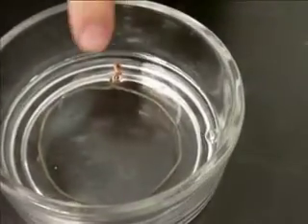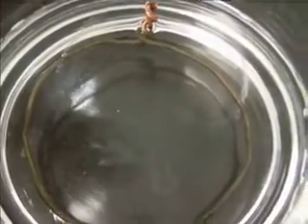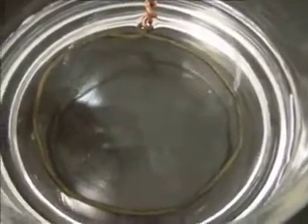Yeah, but you can start to see it's no longer that shiny copper color. It's starting to turn into kind of a darkish color. That's actually silver that's forming on the outside. What we're going to do is stop this. We're going to come back in a couple minutes and see what that looks like.